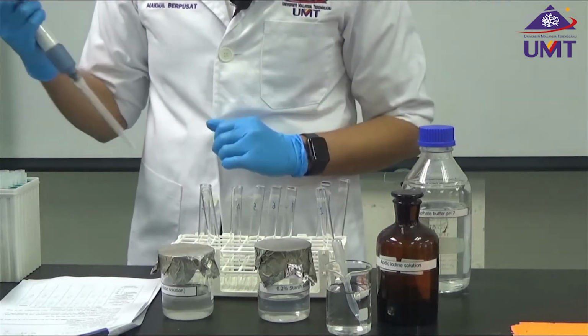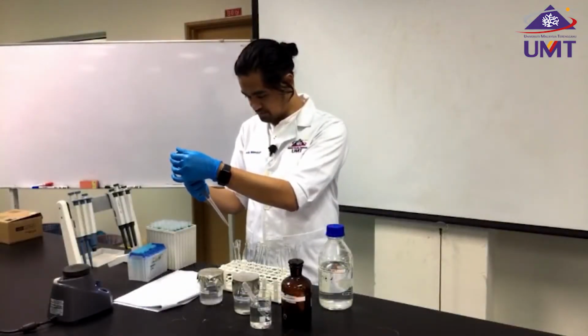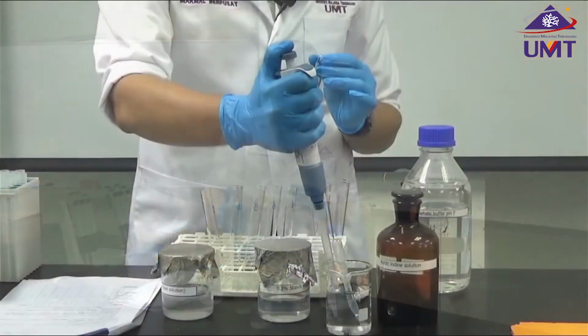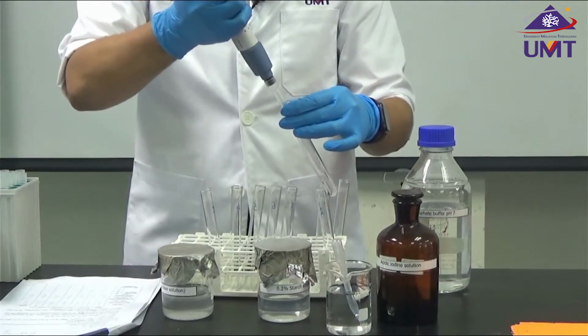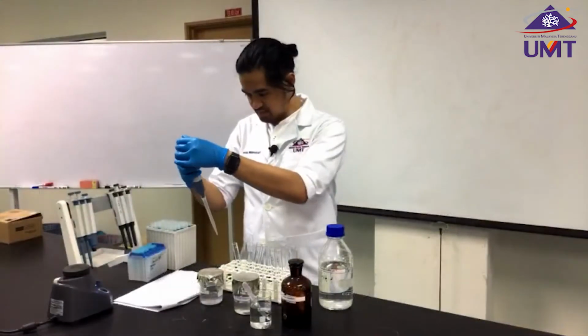The second one, I need 3.3 ml of water. The third tube, I need 3.1.